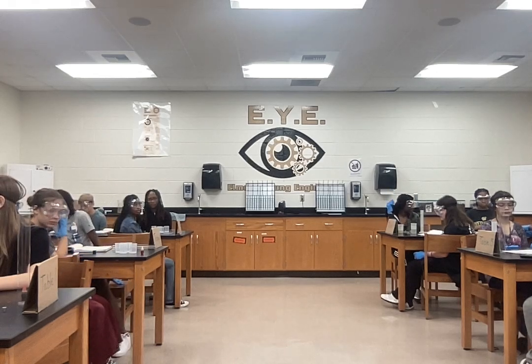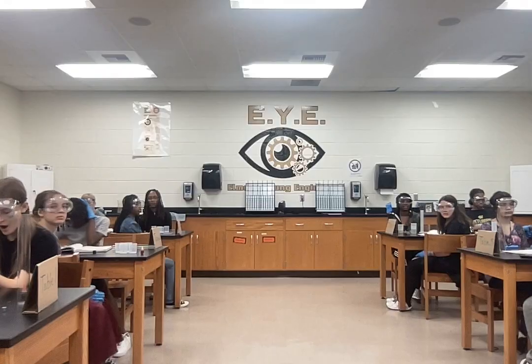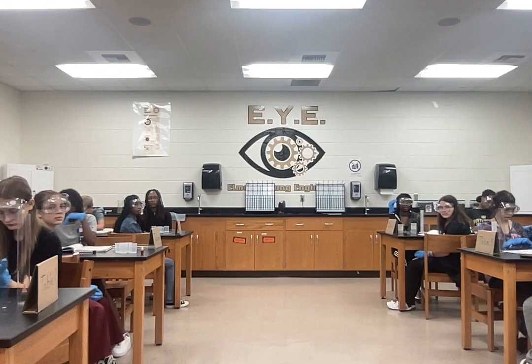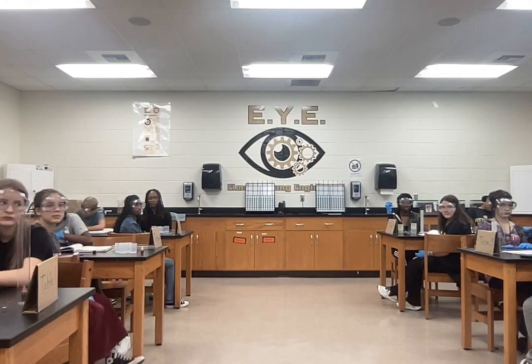So in that final column, it says 50 milliliters of water. The mass of the graduated cylinder is still 34.86, correct? Yes. Now you told me the mass of the graduated cylinder and the water together was 97.83.